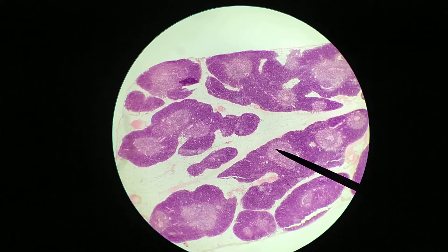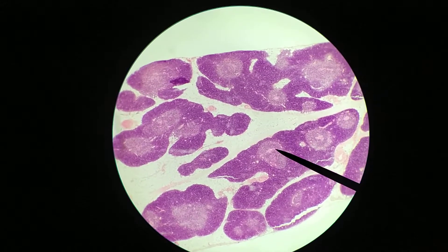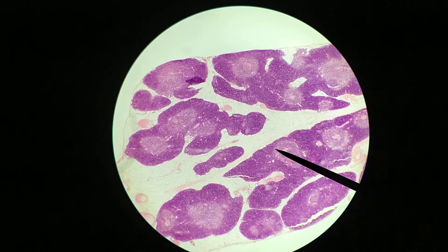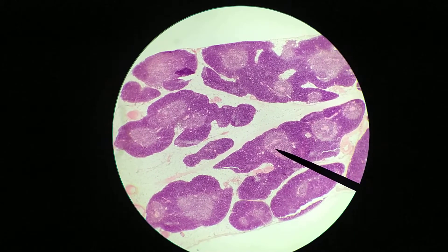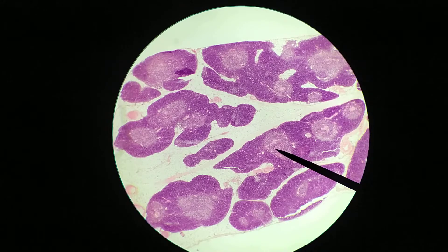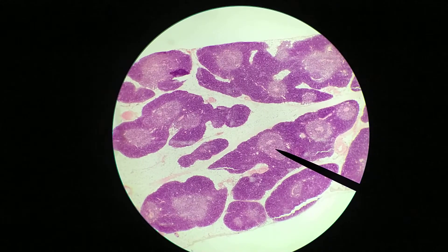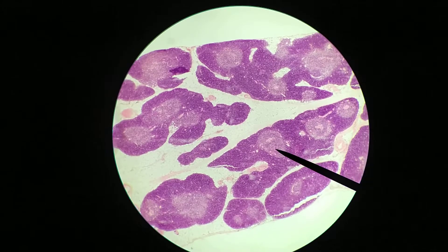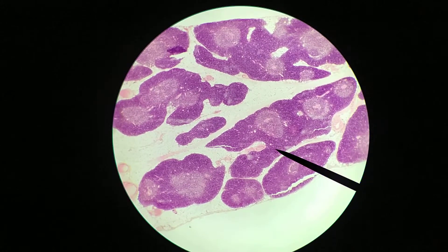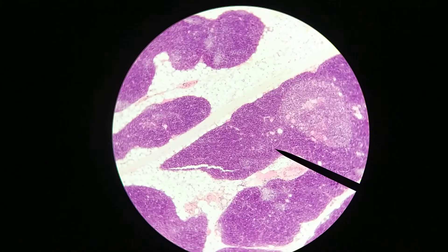Most of the cells in the cortex will actually not pass the test, so most will be removed. Only the cells that are able to differentiate between self and non-self are going to pass across into the medullary region. The medullary region is much less populated — there are fewer cells here simply because of how few cells actually graduate. Once in the medulla, lymphocytes can eventually exit into the bloodstream after being fully tested and shown capable of not reacting to self-antigens.